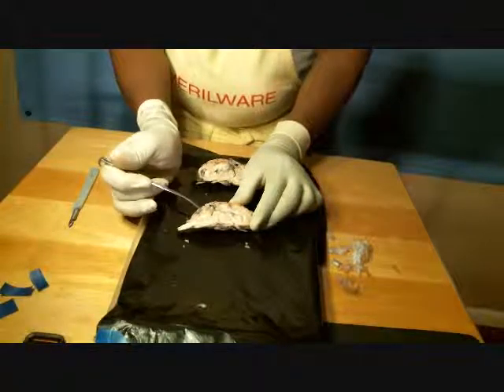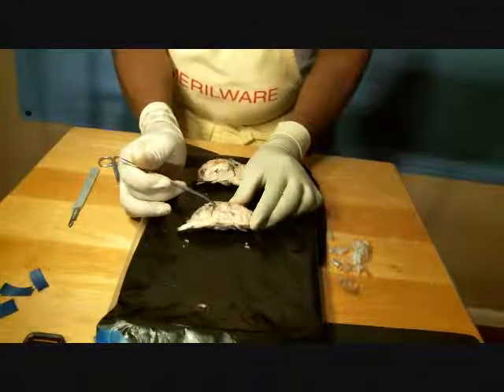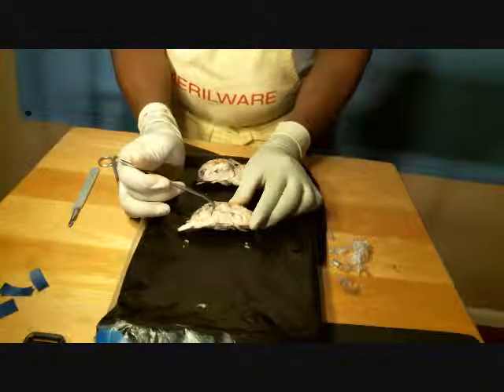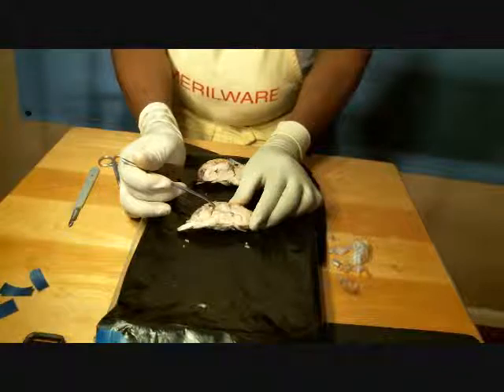As you can tell, I'm very frustrated by this exercise because it's not easy for me to identify the various structures as I look at them. And so, frustrated and quite honestly lost.